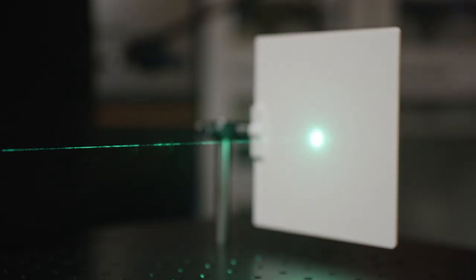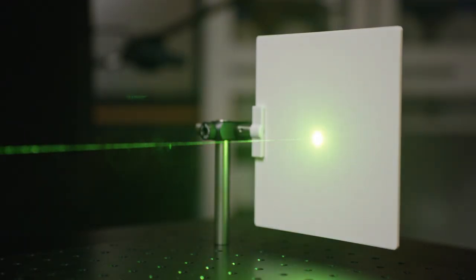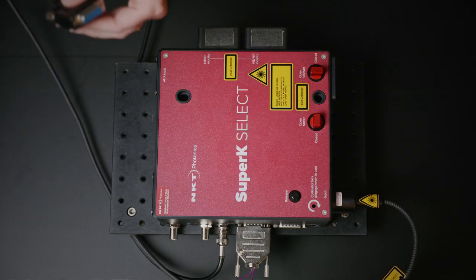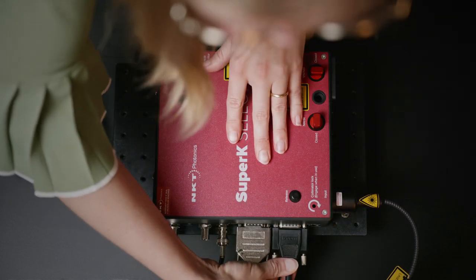The colors change as I go through the spectrum. If you need more colors at the same time, we have another tunable filter. The Super K-Select is a multi-channel tunable filter, and to control it you use the same software.